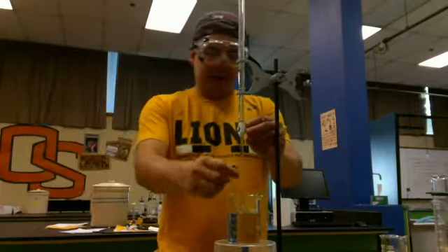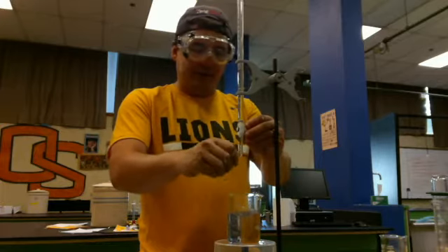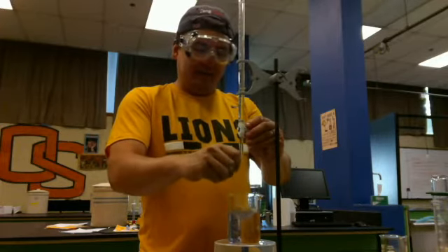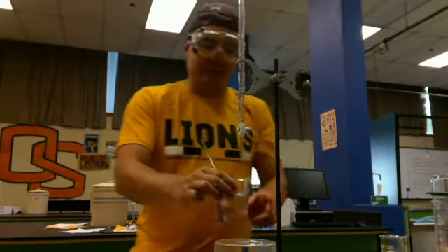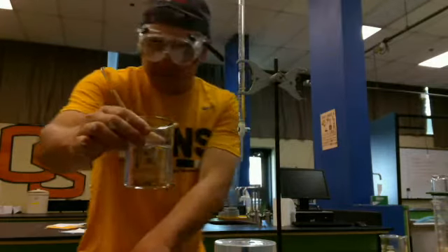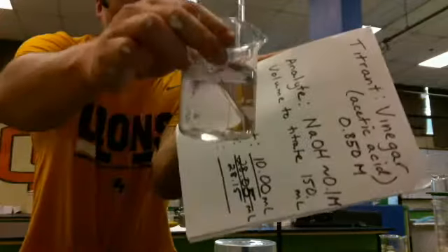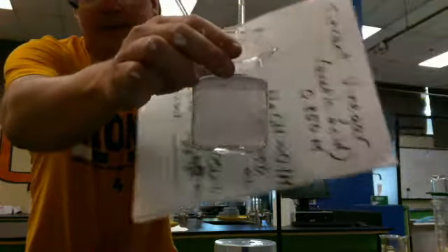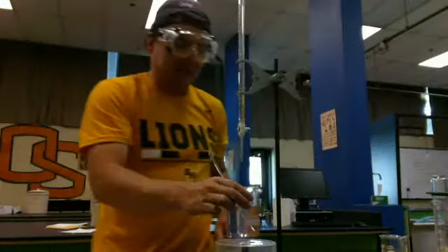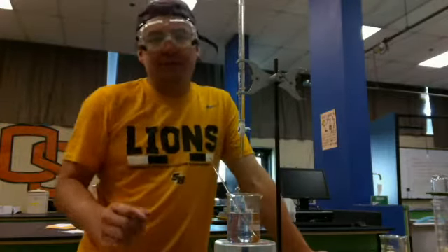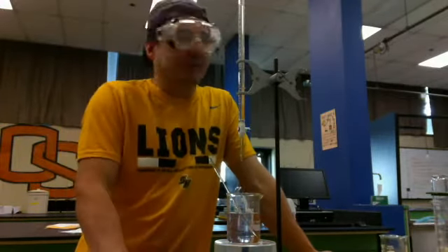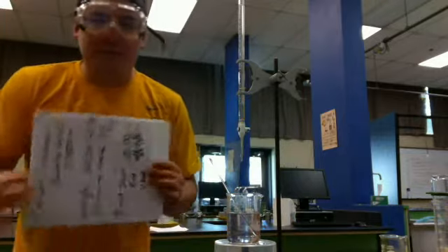And so I should probably record 28.15. And I'll see if I can go. Now, this is probably what happened in your lab. I definitely see you guys kept going. This is probably exactly what happened. You kept going to try to achieve a darker shade of red. Now, different indicators behave differently. If we were doing this in the lab for real, we would use, instead of cabbage juice, we would use phenolphthalein, and that was that magenta indicator. So I'm going to go with this, 28.15.